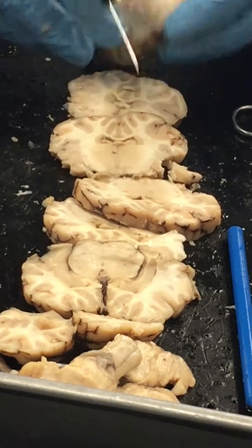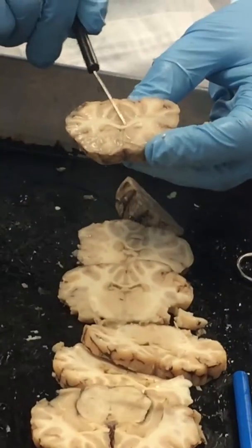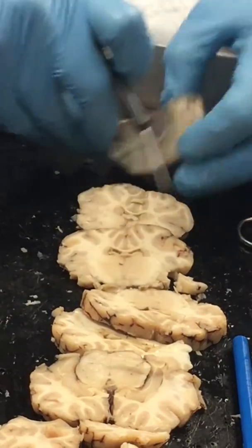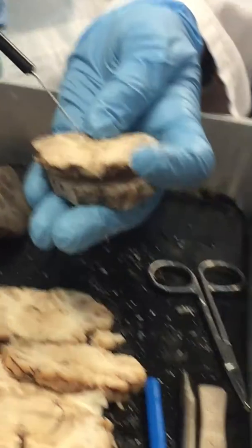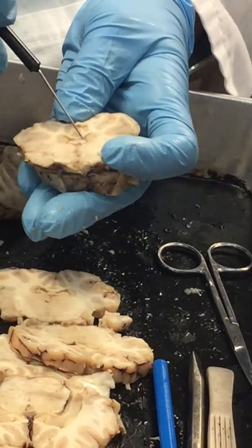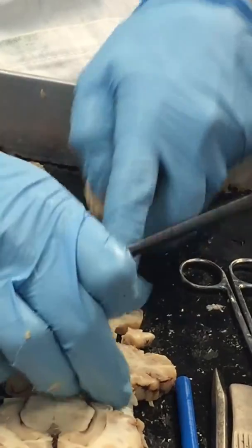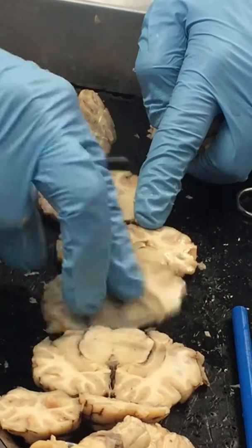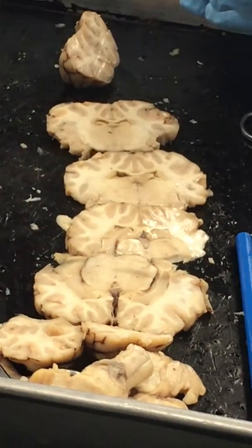So as we look at this, we could see this white matter, this connection. This is that corpus callosum, that connection between the two halves, the left half and the right half. Now that corpus callosum, as we go down and kind of look at these sections, again, these are our ventricles. These are the lateral ventricles, those spaces. And you can see the space here. You can see it in this section here. Actually, if we line it up the right way or the same way, all of this is those spaces. These are all those ventricles.